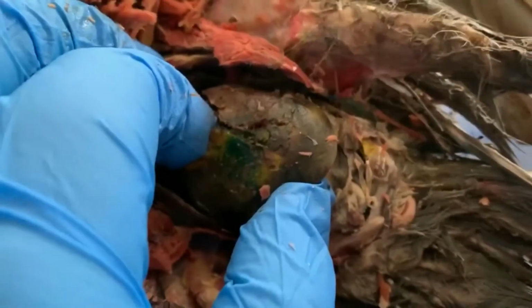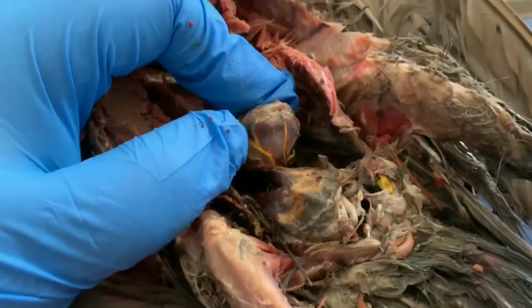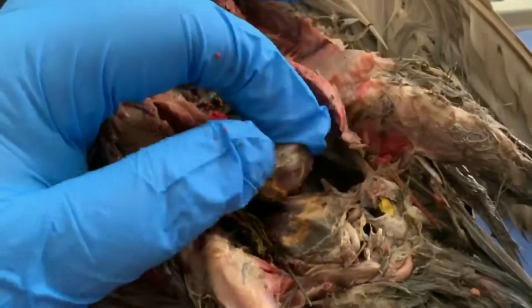As we look farther down in the abdominal cavity, just like with our frogs, one of the big organs that we're going to see on the top is the liver. So here we have the pigeon's liver. It is 2 lobes. This is one of the lobes. This is the other.